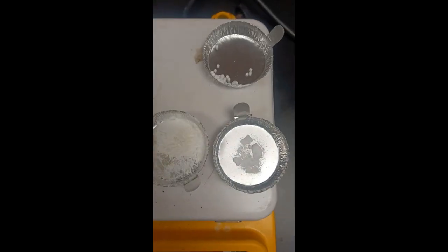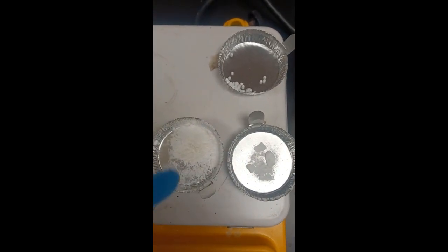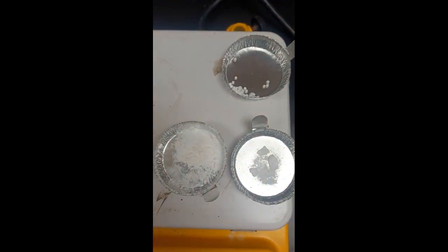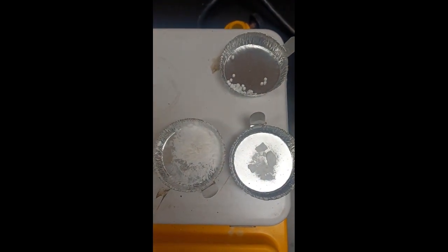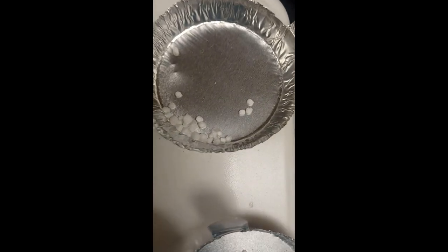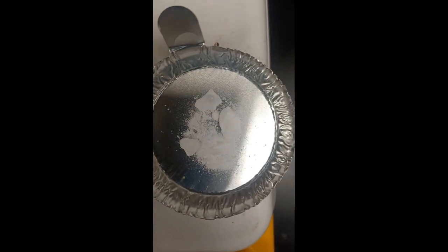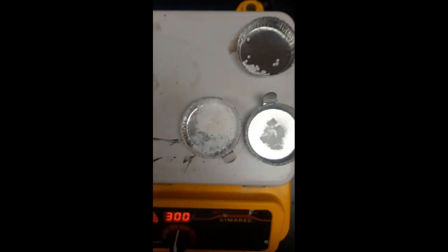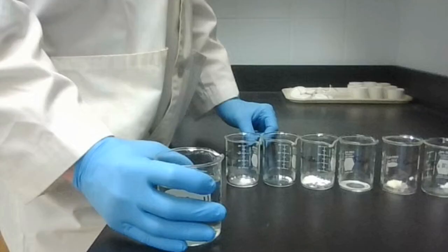Now, our last three samples, the cornstarch, the sodium acetate, and the calcium chloride. I don't see any change, and we're just getting towards that 1 minute mark. I'll zoom in on them here. Calcium chloride, I don't see anything going on. I don't see anything going on with sodium acetate, and I don't see anything going on with cornstarch. So those three do not melt.